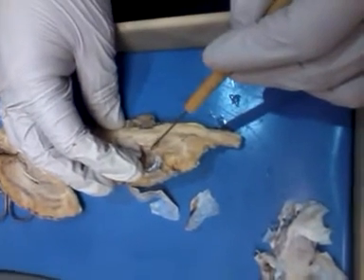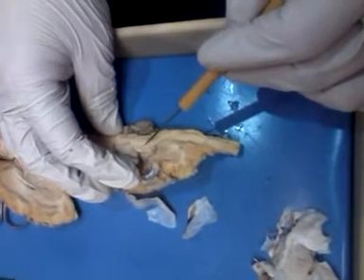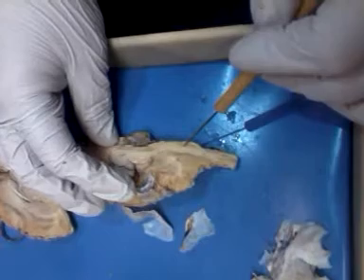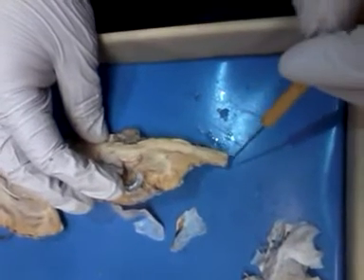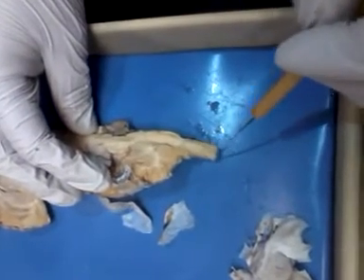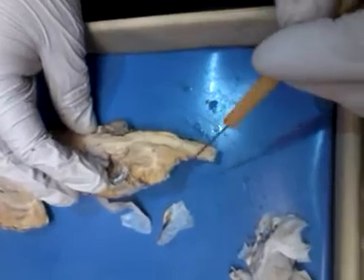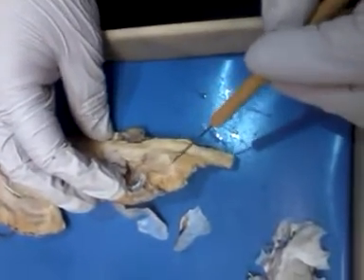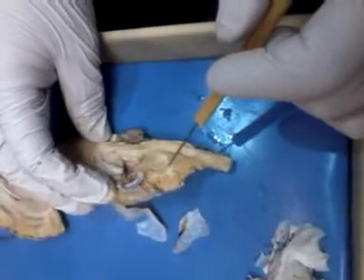So then this part here, on either side, midbrain. You've got corpora quadrigemina of the midbrain, and then you've got pons and medulla oblongata. And then right down here, that's your spinal cord. Okay? Now, this is your cerebellum. Of course, they're going to ask you that. They're going to ask arbor vitae.